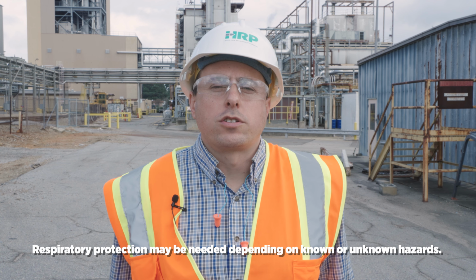Was it immediately packed on ice? In this case, yes, it was. This may or may not be required. Again, prior to taking the sample, it's important to contact the laboratory to make that determination if that's a requirement. Field filtered, if applicable. There was no applicability there. We didn't need to filter it prior to taking the sample.